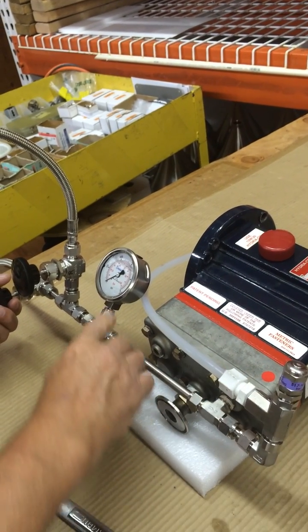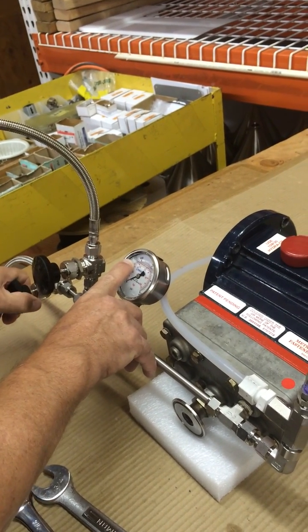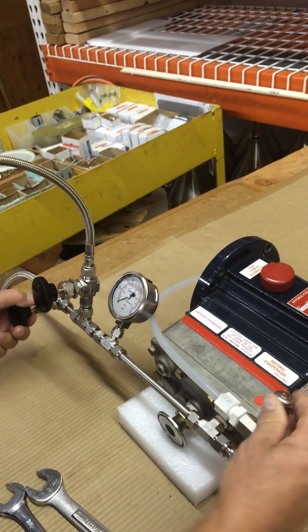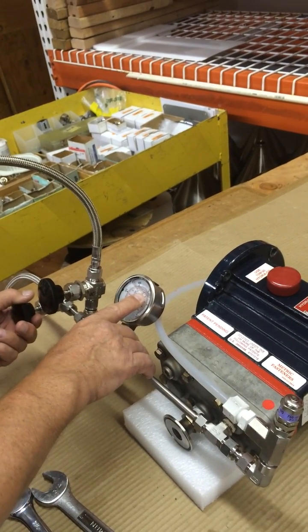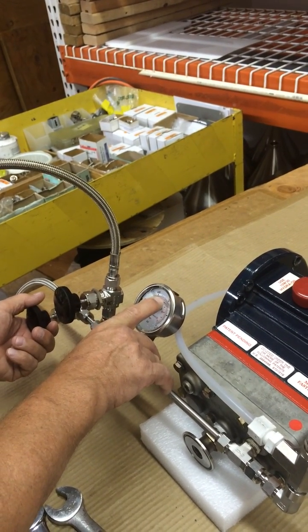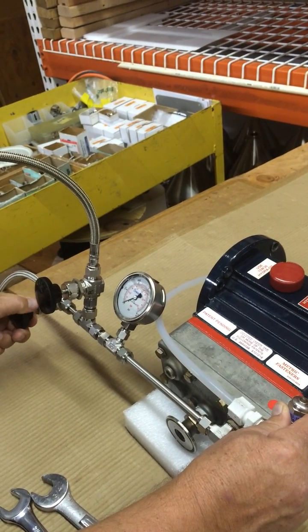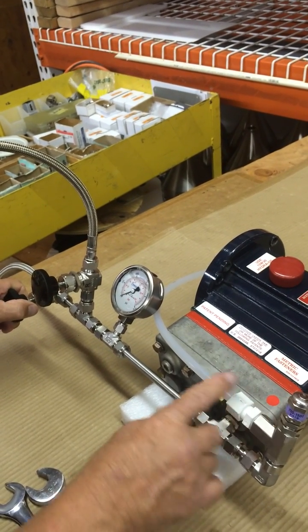Which should let the pressure come up higher again, so turn your valve back in — it will reach 400 and then it should open up. But back it back down a little bit, you can turn this up, and you just keep repeating this until you get it up to 900 psi. When you get it up closer to 900 psi, you just want to turn a little bit, and then turn your pressure — your concentrate valve back in — until the spring lets it pop at 875 or 900.